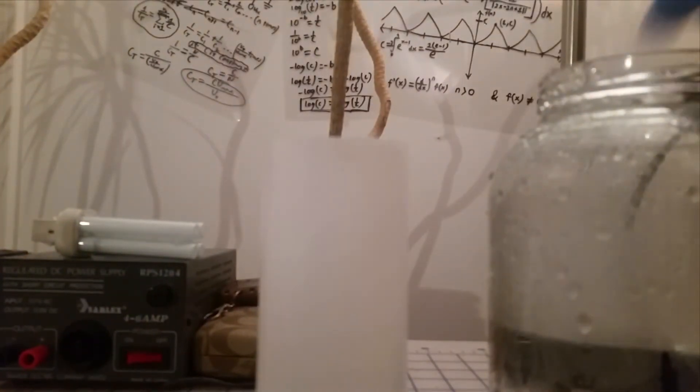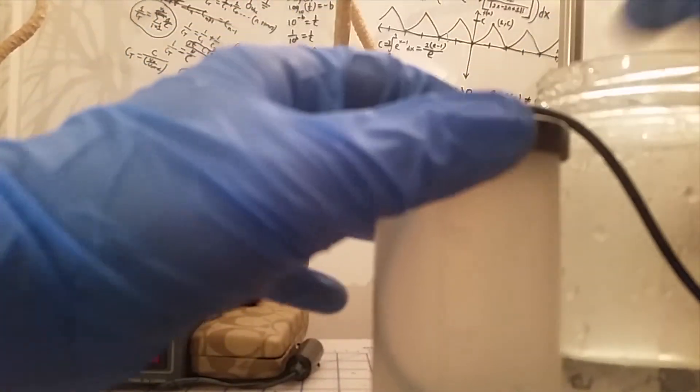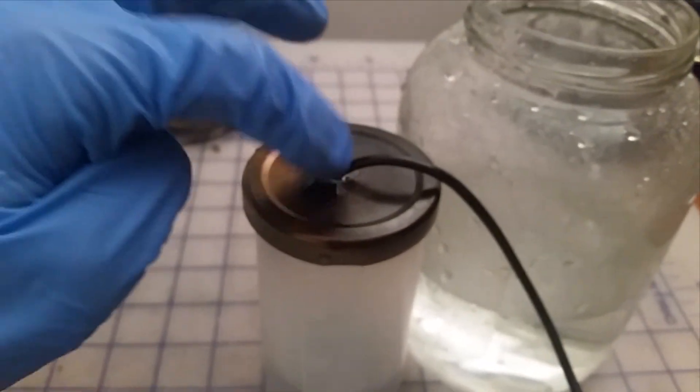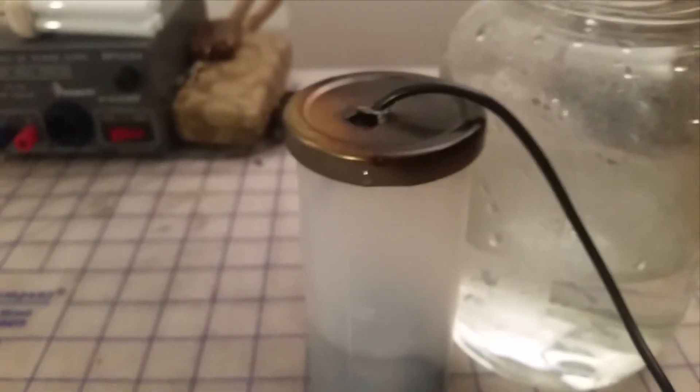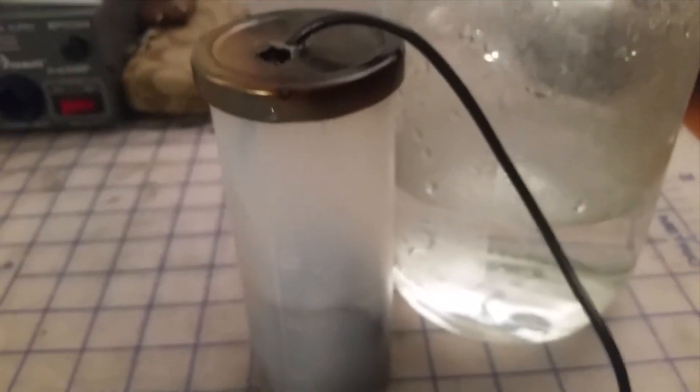I found a container about the same width as the transducer so it covers it nicely, and a small can lid that fits over it. It doesn't have to be airtight — you don't want it to be completely airtight because we're going to be pumping ammonia gas in through the lid, and you never want to heat a closed system in chemistry as it'll build up pressure and the whole system will explode. So we want gas to be able to vent, but we don't want the ammonia to vent freely either — just a little airflow so pressure won't build up.